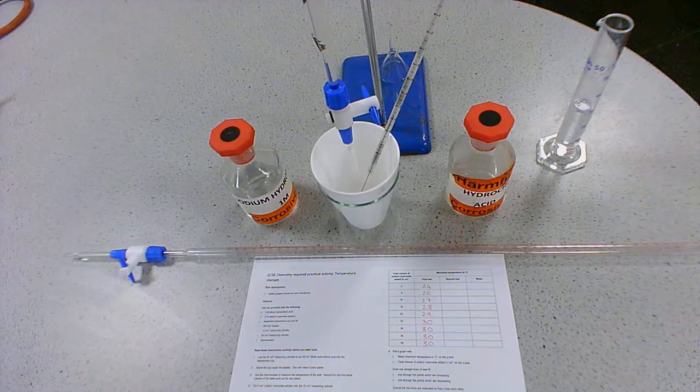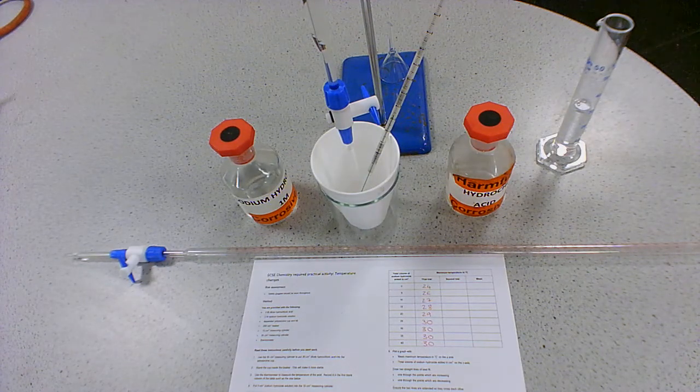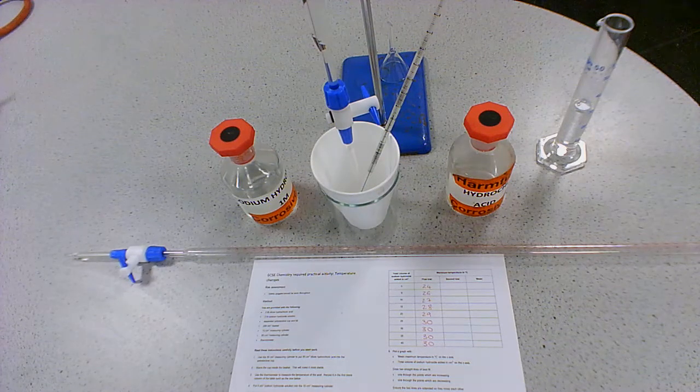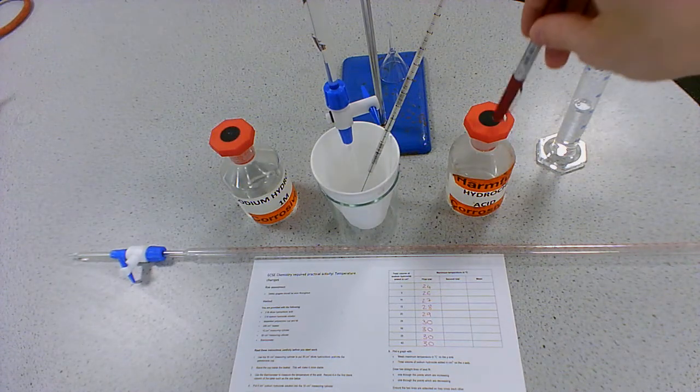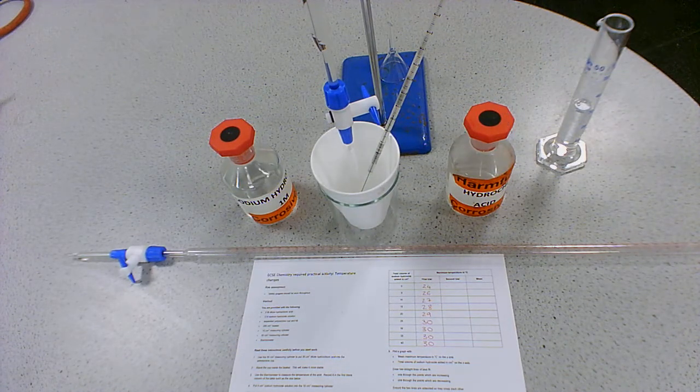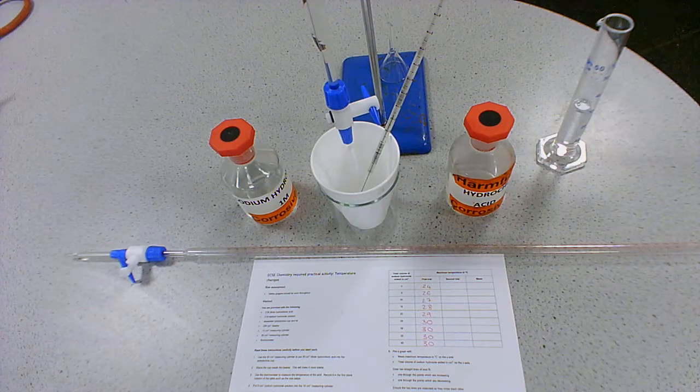So at the moment, we don't know whether this reaction is going to be exothermic or endothermic, but by measuring the temperature change when we add the sodium hydroxide to our hydrochloric acid, we will be able to work out how much is needed to neutralize it.